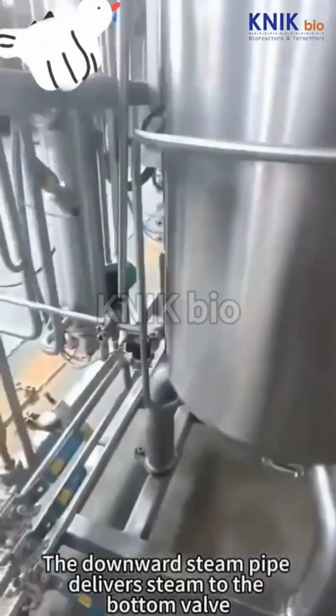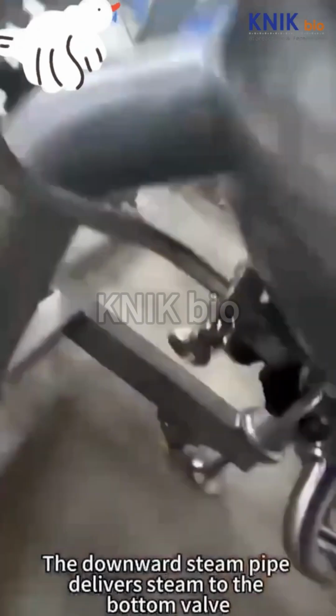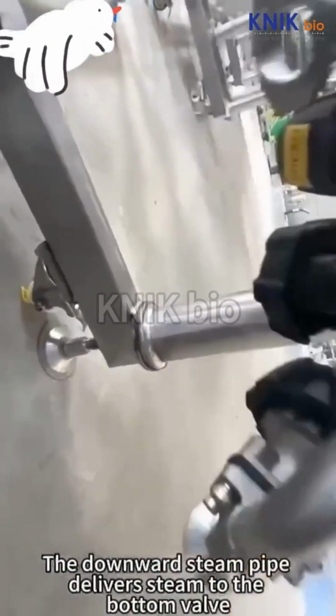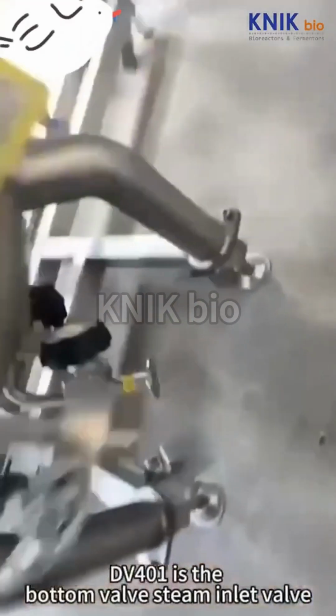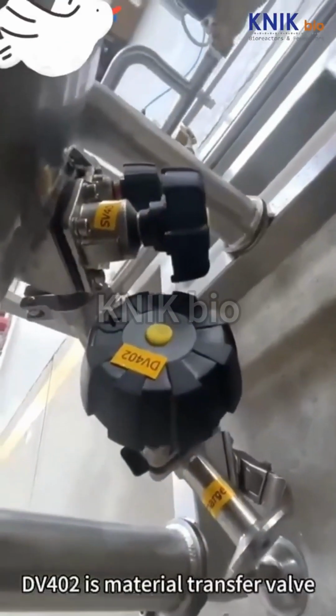The downward steam pipe delivers steam to the bottom valve. DV401 is the bottom valve steam inlet valve. DV402 is the material transfer valve.